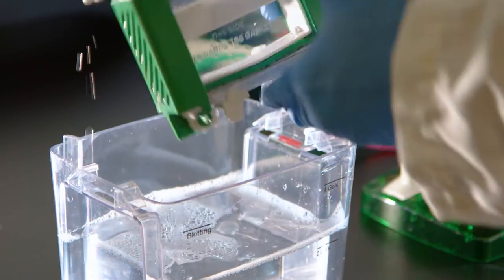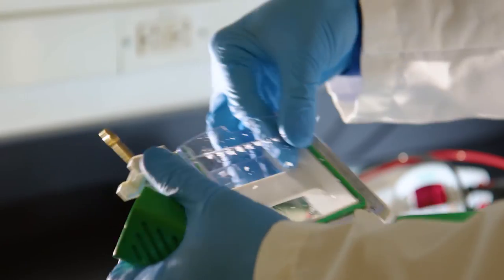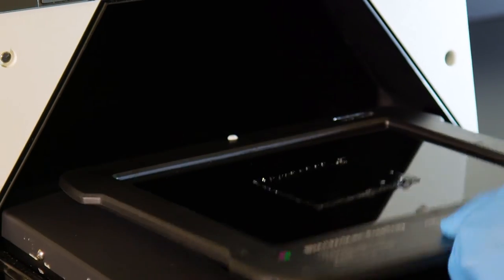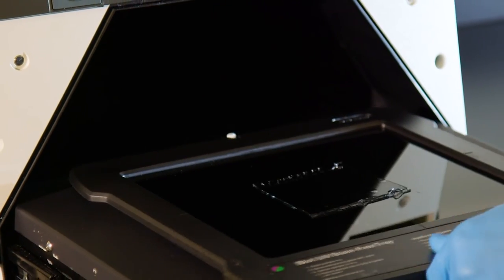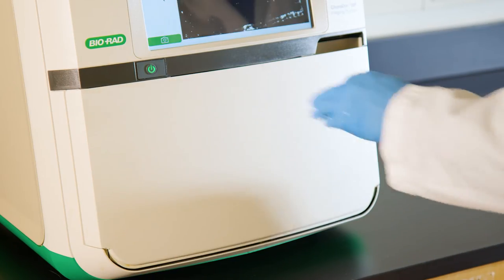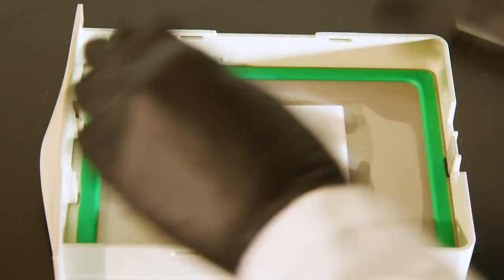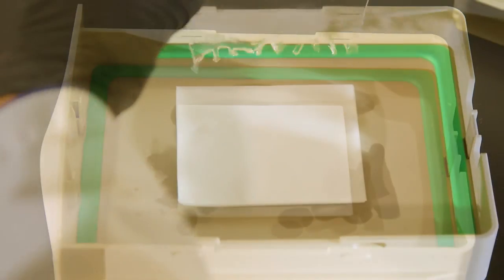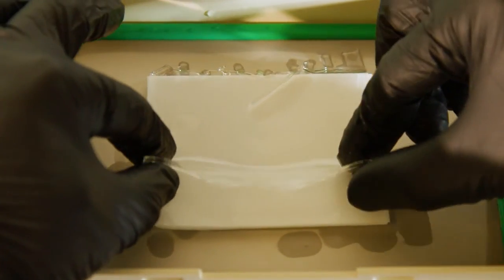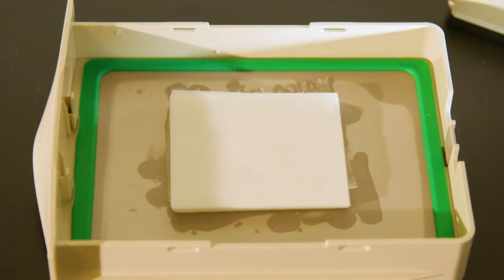First, capture the stain-free gel image after electrophoresis but before transfer, using any Bio-Rad stain-free enabled imaging system. After gel activation, transfer your proteins to a nitrocellulose or low fluorescence PVDF membrane as usual.